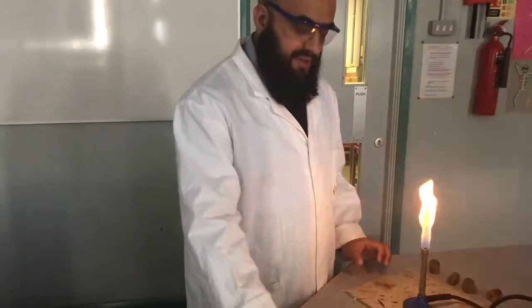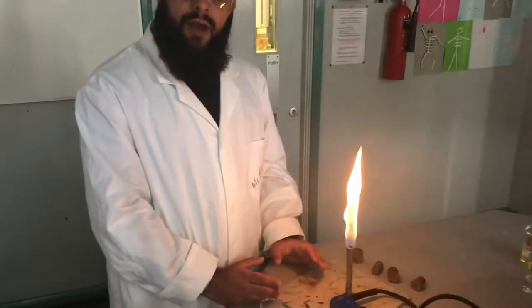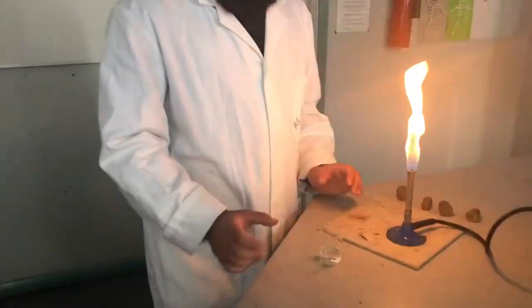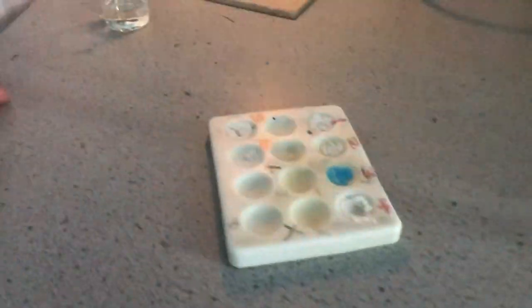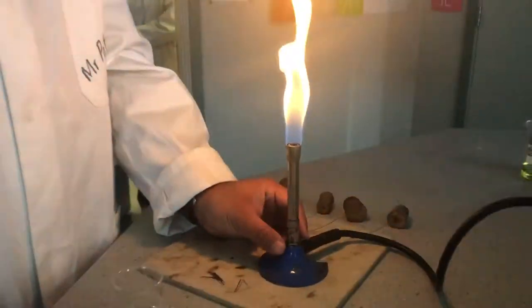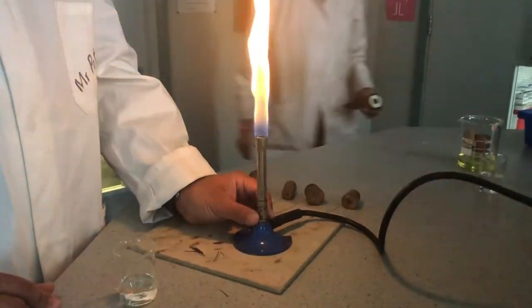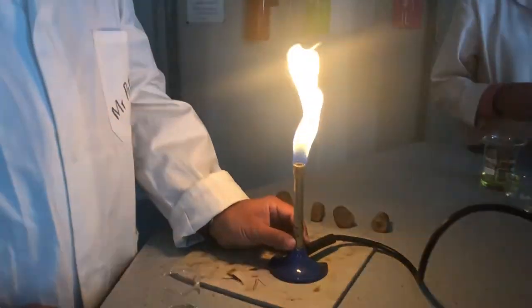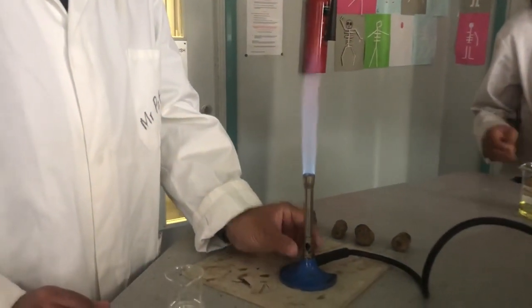Next experiment, we'll be demonstrating a more direct use of the Bunsen burner. And so what we'll be carrying out here is a practical called flame tests. What I've got over here is my palette with my samples in there of different metal compounds. And if we return back to the Bunsen burner, as we described earlier, we will not be using the yellow flame. We'll be using the blue flame, so I'm going to open the collar of the Bunsen burner to get that complete combustion going.